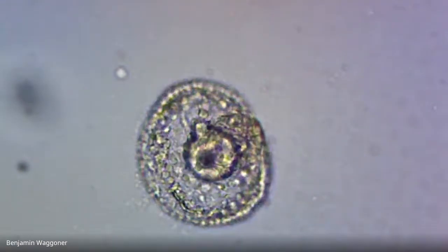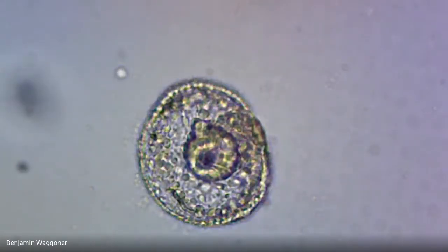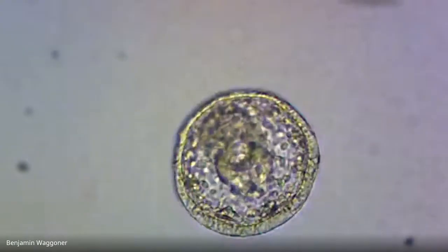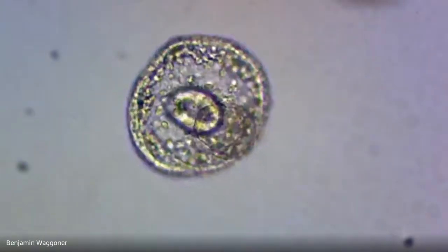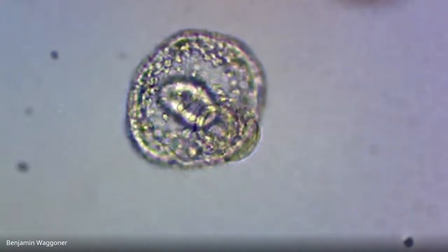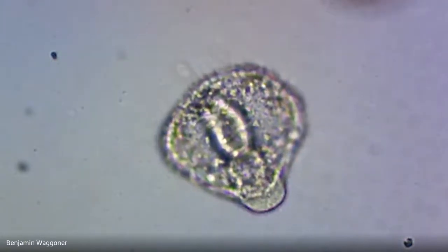Okay, I'm going to call that one a late gastrula. It doesn't look too damaged. This one's actually still alive enough that it can swim on its own. Yeah, so there you can see the blastopore. And okay, I'm seeing some, it's kind of turning. So there's that schnoz that it's got. Whoops, come on, Wagoner. Come on, stay with it.